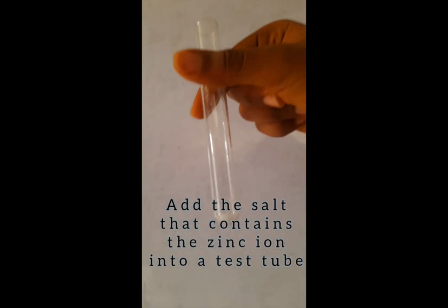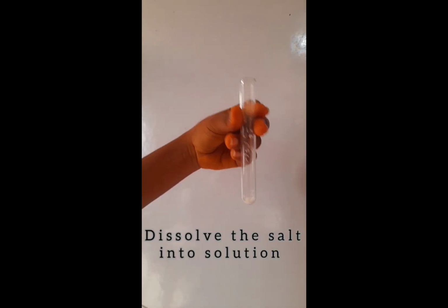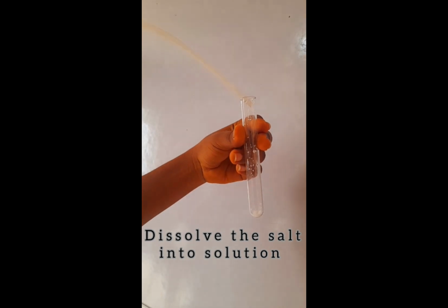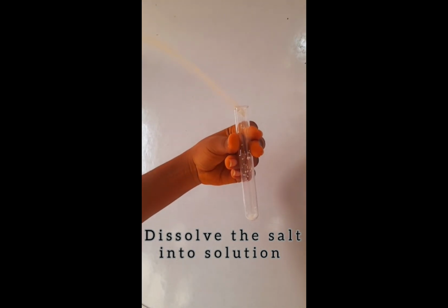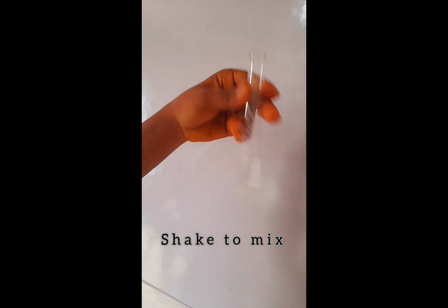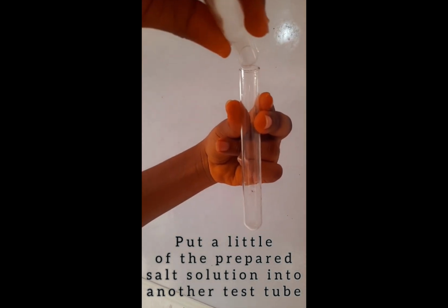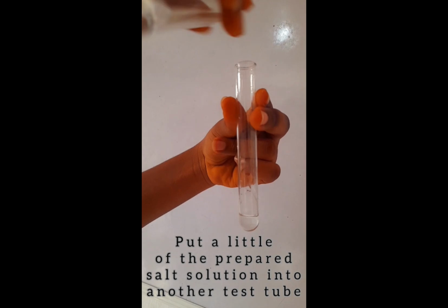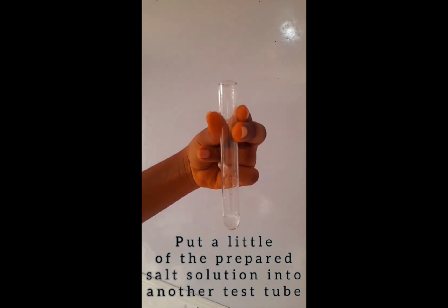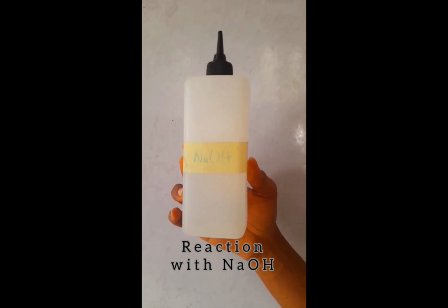Now we are testing for zinc ions. Remember that zinc ions can be tested using sodium hydroxide and NH3. So in this video I'm going to show you how to use both ways, sodium hydroxide and then NH3, but NH3 is what is in our table. So we dissolve a salt that contains zinc ions into solution and mix it properly. Since we're going to test with sodium hydroxide and NH3, we divide the mixture of the solution into two parts.